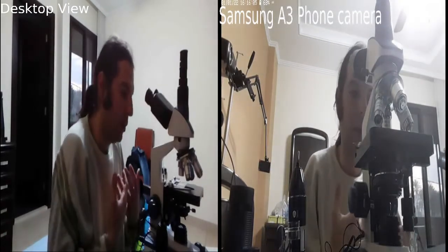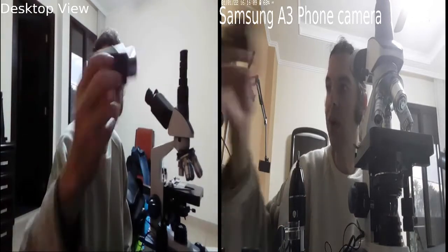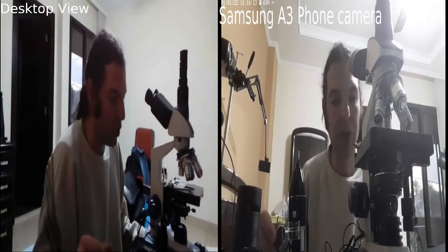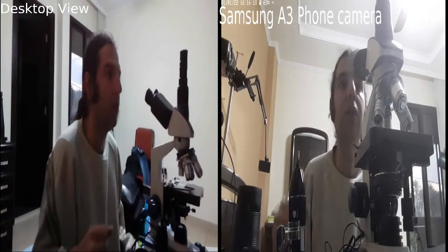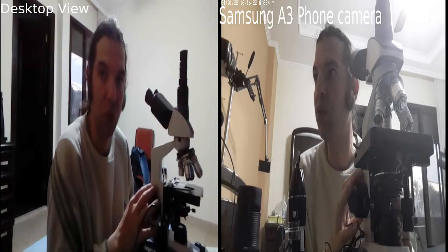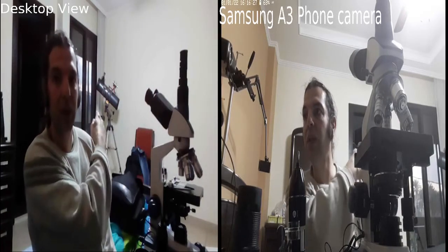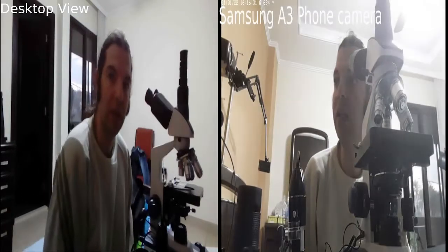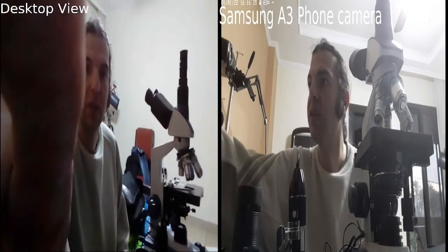So if I want to use the eyepieces of a telescope on a microscope, yes, we can. This is the question, whether we can use them or not. So how are we going to use them? Look here. I have an AmScope microscope. Here in the back I have a Celestron Astromaster 130 EQ telescope.